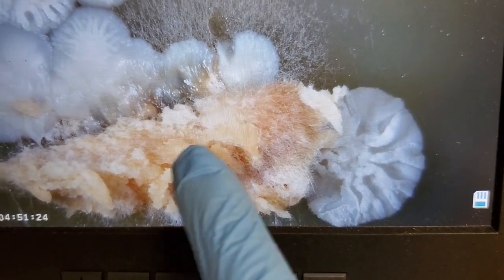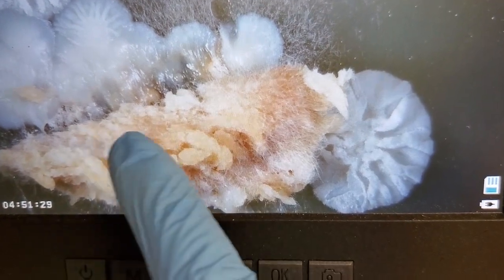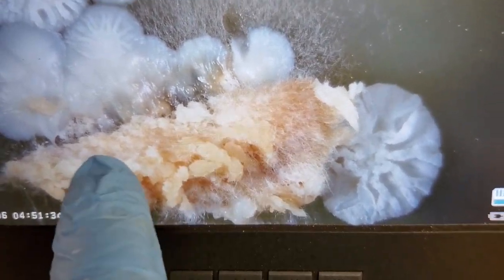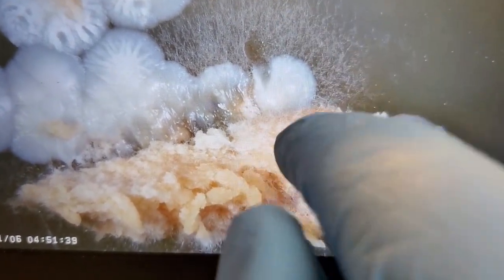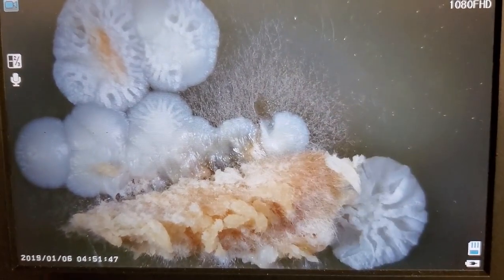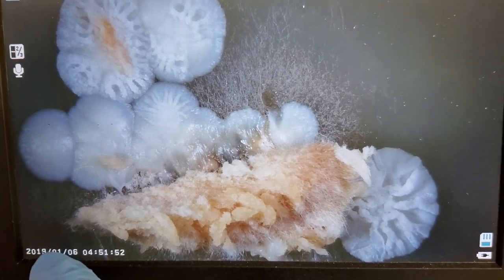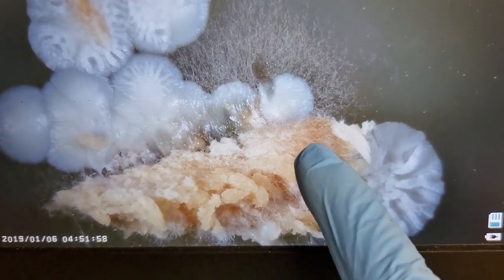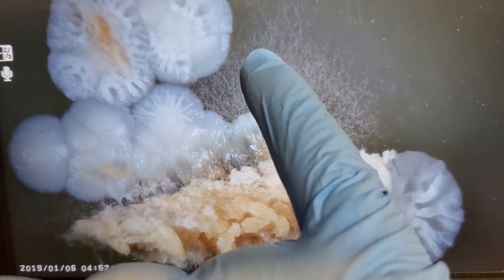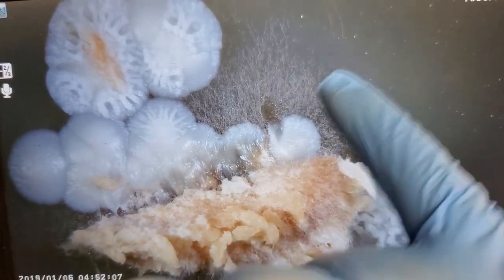So once this is isolated and put into an environment that will allow it to continue to grow, it will start to grow just like it was growing from spore, basically. It will put off little filaments of mycelial growth and try to colonize whatever it is placed on top of. And don't pay attention to the date stamp on here. I never bother to set that, because every time I unplug it, it resets, and I don't care. But anyway, you can see that it's trying to put off some growth, and we do have some radiating outward from the tissue sample onto the actual petri dish.